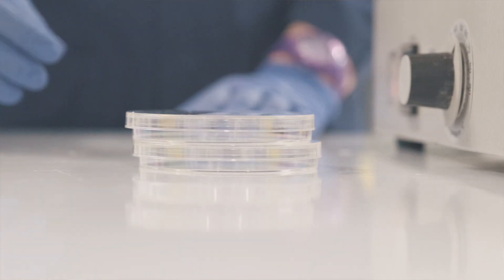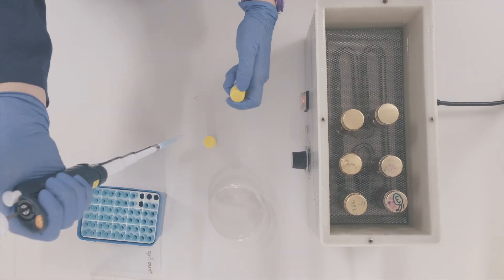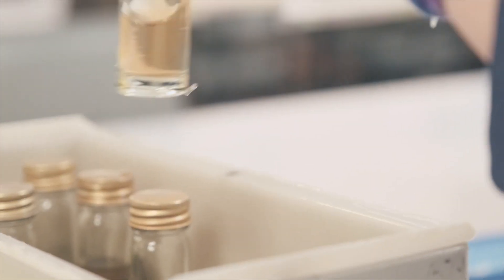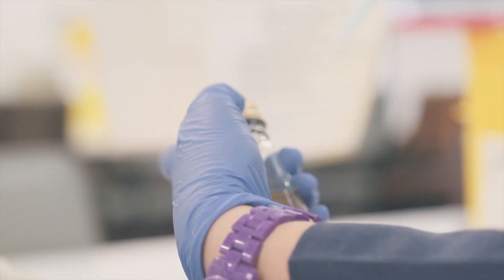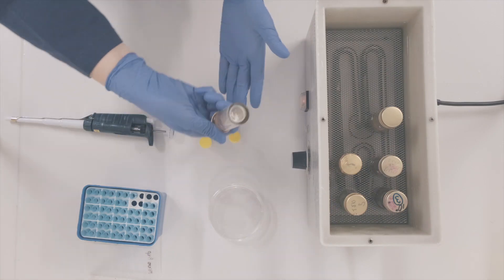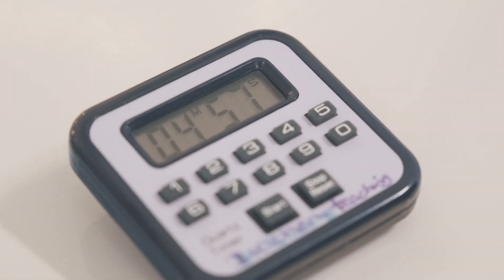Label two agar deeps and two agar plates with the organisms' names. Add one milliliter of each bacterial culture into the agar deeps and immerse them in a 60 degree Celsius water bath for 5 minutes to kill the bacteria.